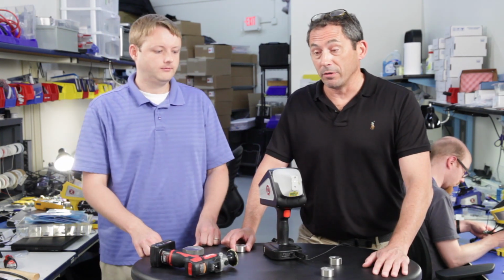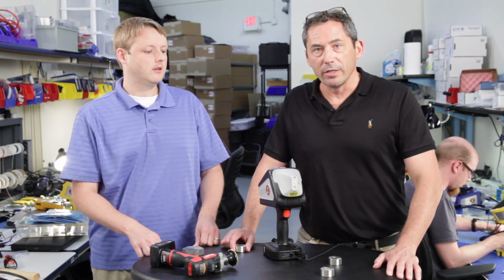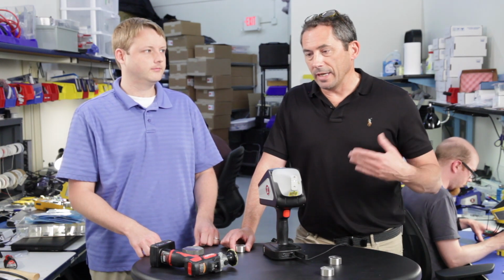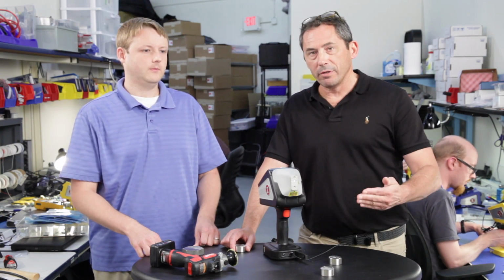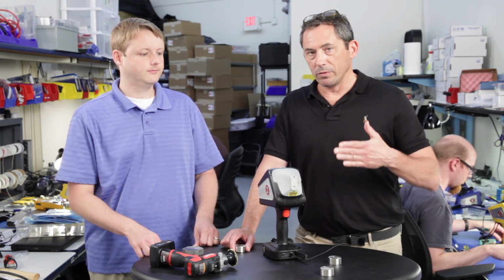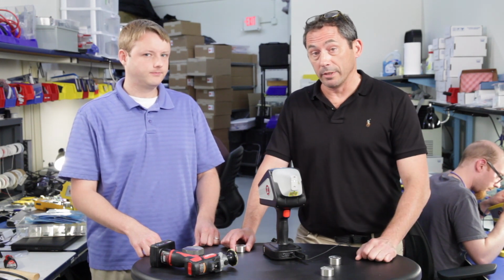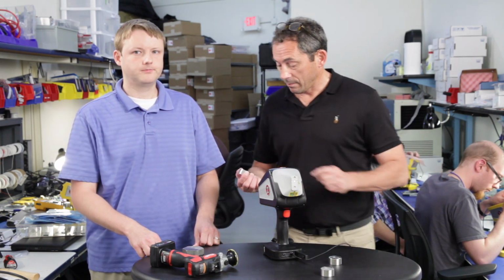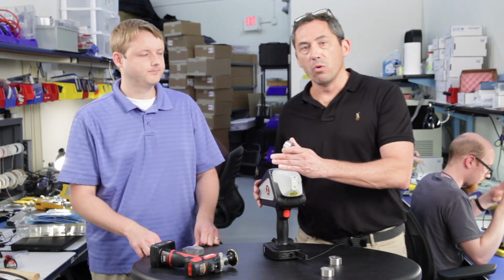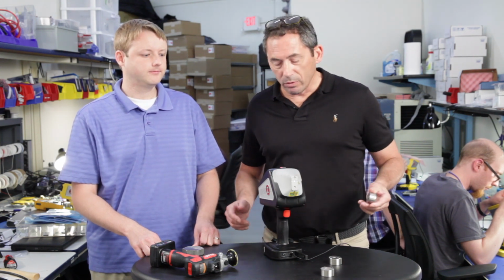Like I mentioned a few of them earlier that were really helpful, that have done this all their lives, been doing L grades for 20 years, maybe not that long, and they'll tell you you've got to have a pre-purge, you've got to have a pre-burn. There's these things you have to do to really get repeatable results with OES. So it's only logical if you have to do them with OES, you have to do them with LIBS. So these are really extraordinary things to be testing on a handheld in a lab. Absolutely, yeah. This is the only handheld in the world that can do this level of carbon testing. Only one in the world.